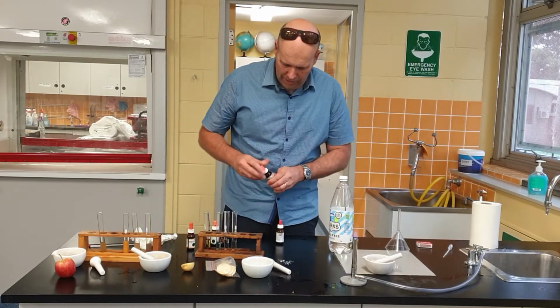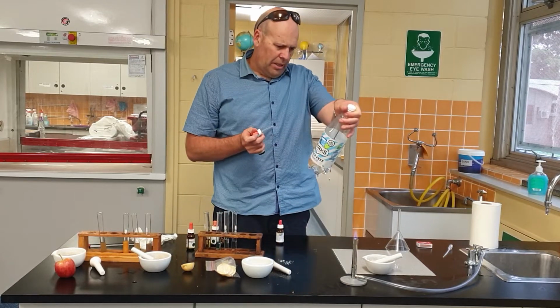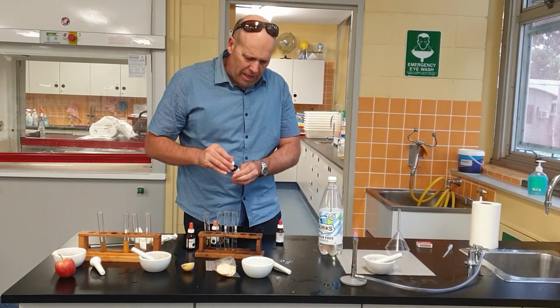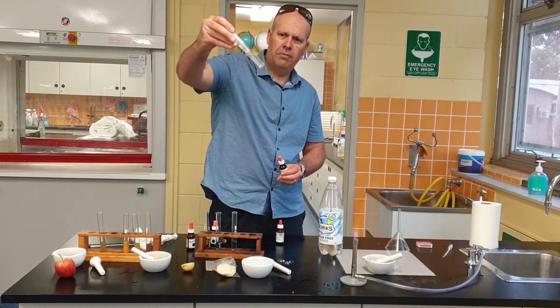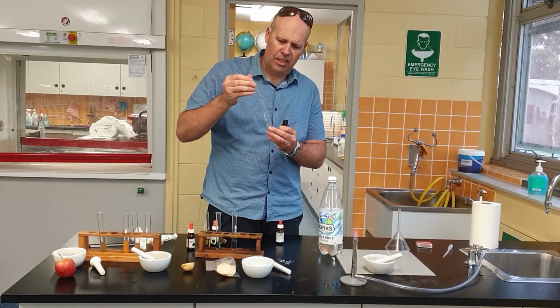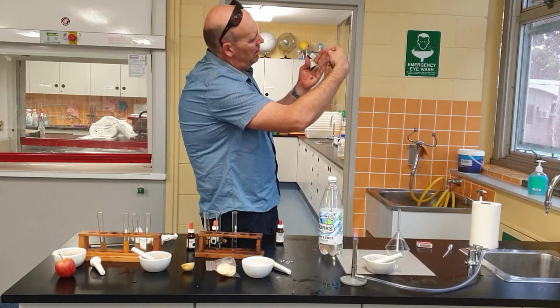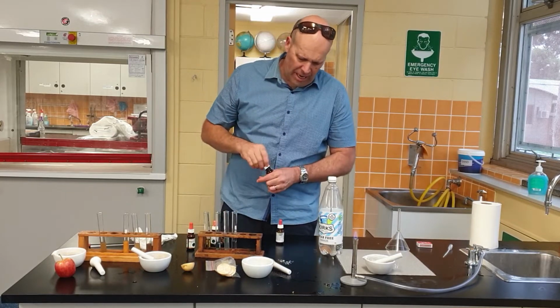All right, second last one. It's protein. Now, what does the label say? The label says protein 0.1 of a gram, so it's a very, very small amount. Will it show up? No, it hasn't gone that purpley colour, but has it? Oh, it's a tricky one. There might be, I don't know. Very, very hard to say.